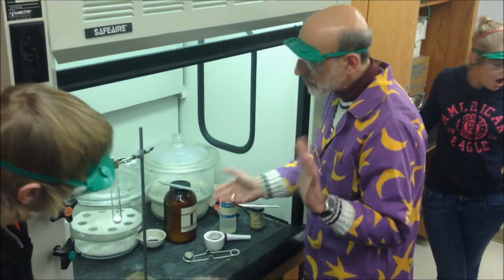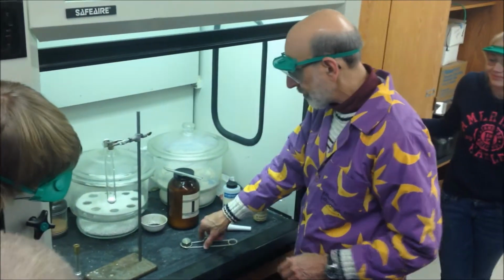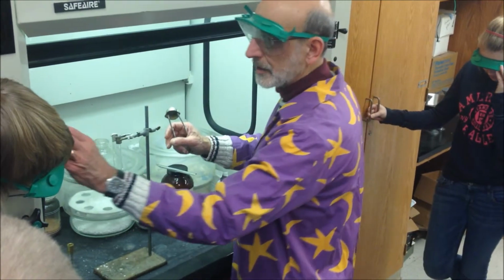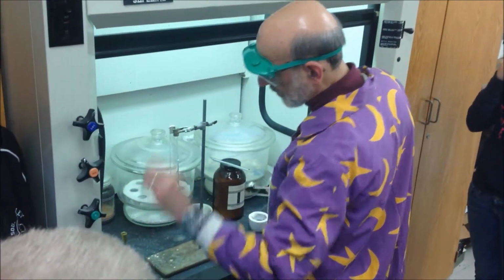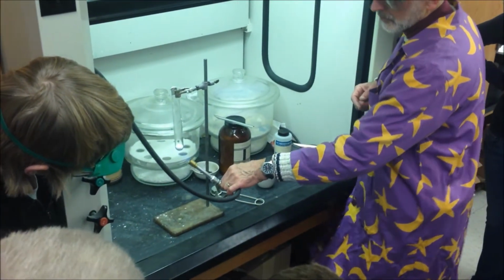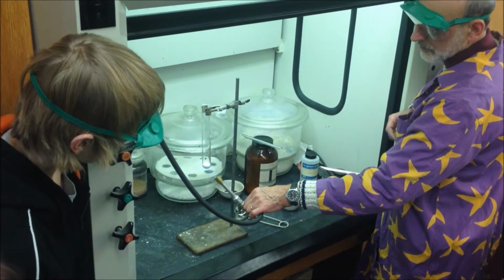Now, things we're going to learn about, like types of bonding, ions. When ions bond together, the bonds are very strong, which means all ionic compounds are solids at room temperature, with very high melting points, because the bonds are so strong. But we need to melt this first so that we have it ready to do what we want with it. And you'll see it's going to take a minute or two to melt this, even with the direct flame.